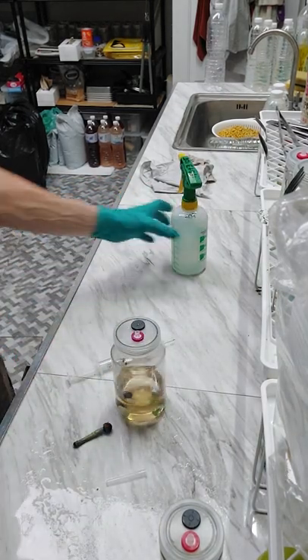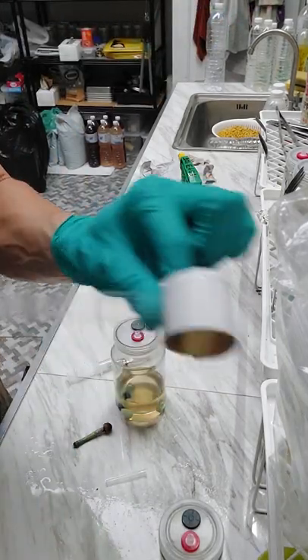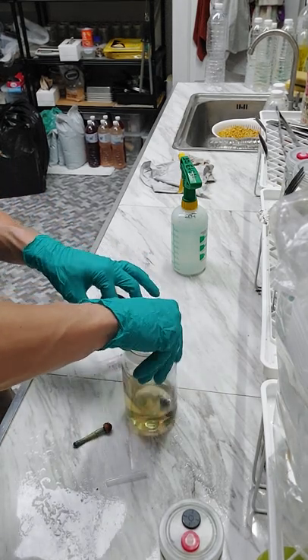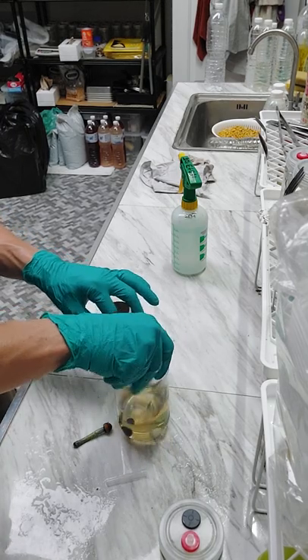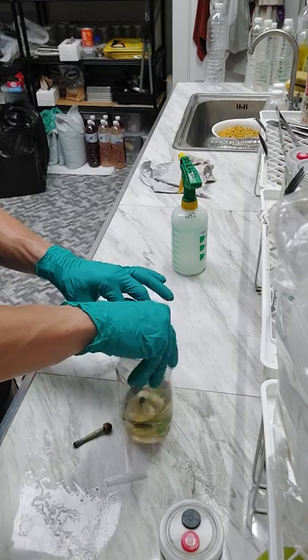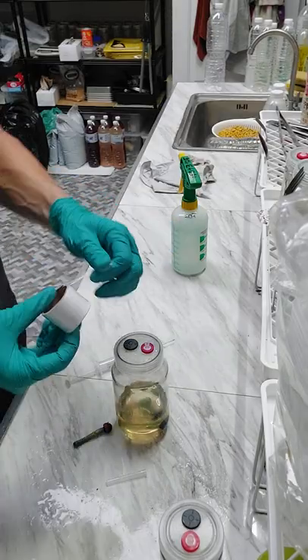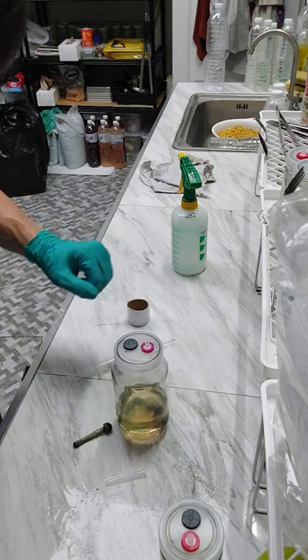And I am also going to label this, and then I'm going to wrap it with my cling wrap here right around the top. I'll do that now like so. I give it a sometimes probably excessive amount of cling wrap, but cling wrap is a lot cheaper than dealing with contamination. If you're doing this, remember to give a little twist at the end so you don't have to peel it off next time you use it.